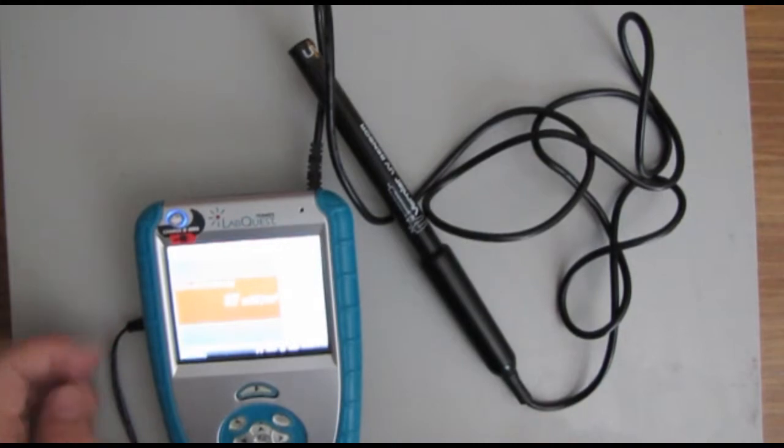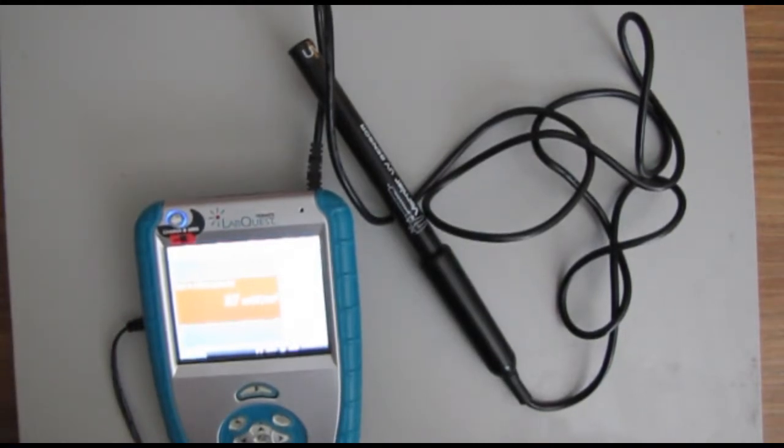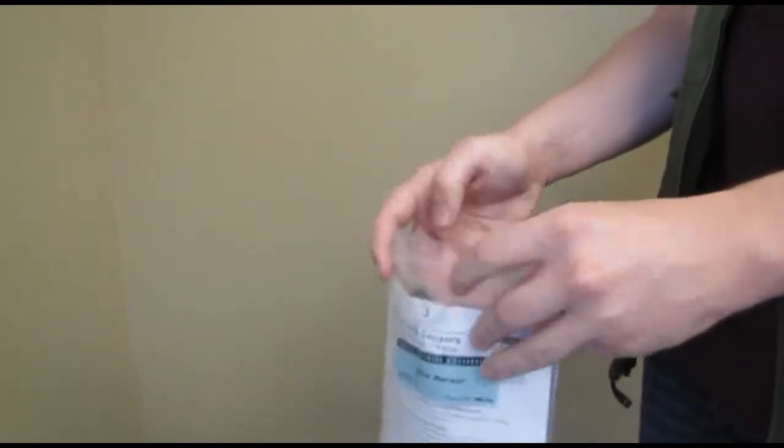That's really all it takes to use the UV sensor. When you're finished with it, put it back into this bag.